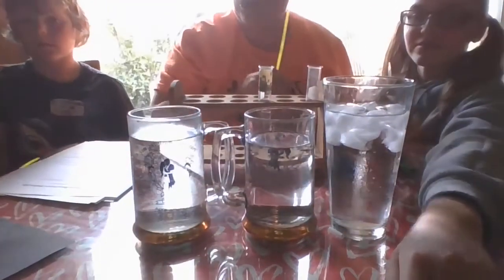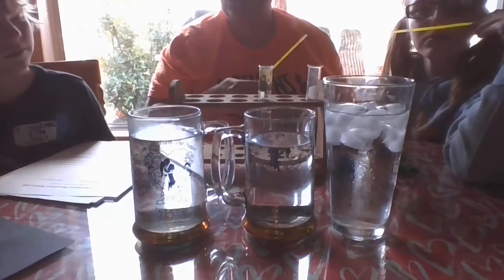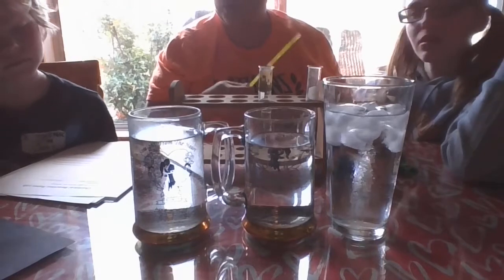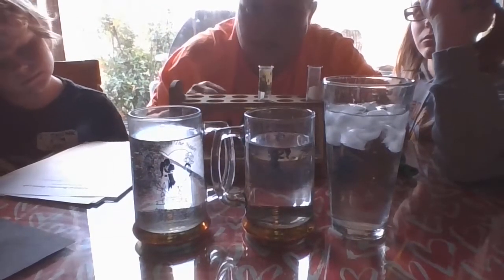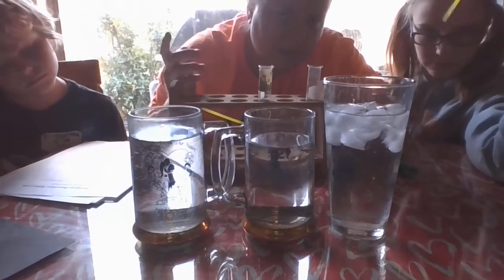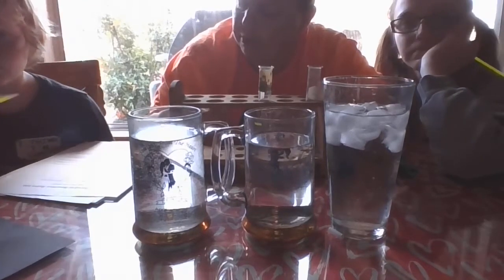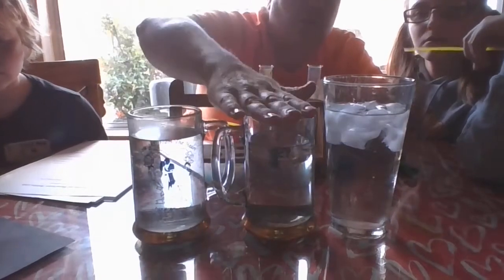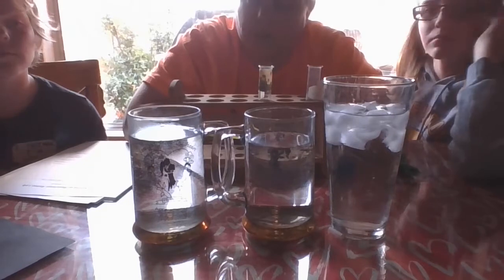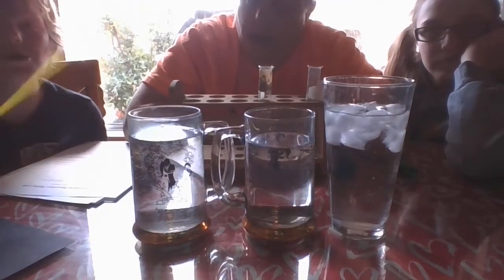Now I want you to answer A. What effect do you think temperature will have on what you observe? What do you think the temperature is going to do to the chemical reaction inside these glow sticks? Increase it, decrease it, keep it the same? And if you think there's going to be a change, which temperature will make the glow stick brighter or increase the reaction? Hot, warm, or cold? Which is going to make it better? Go ahead, take a minute and make your prediction for A. Pause the video. All right, welcome back.